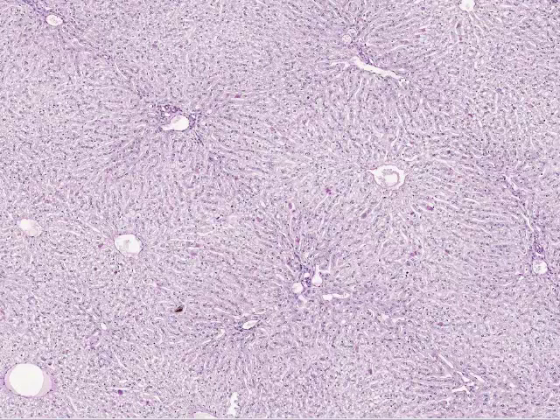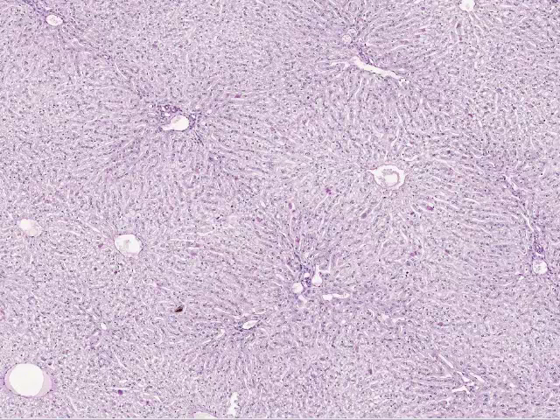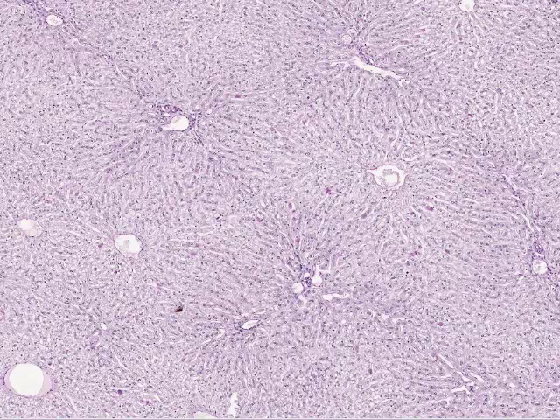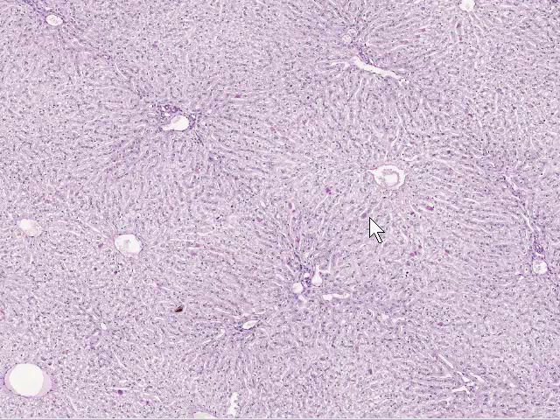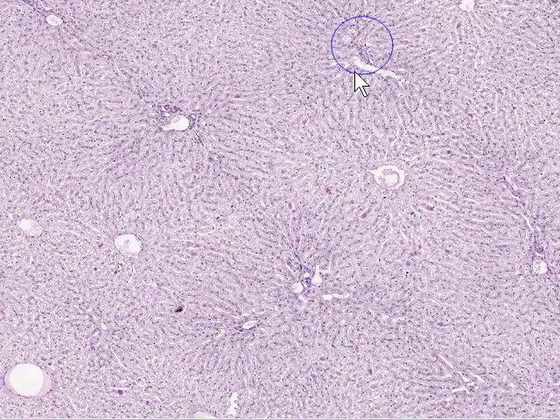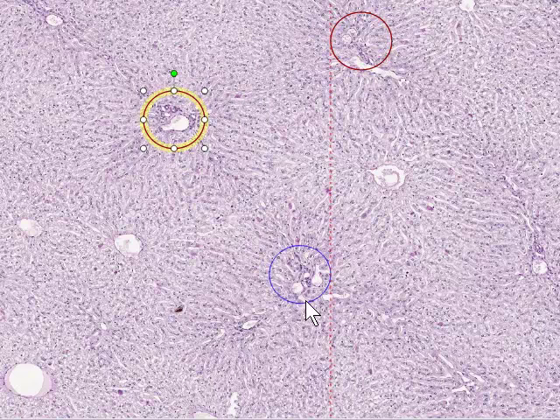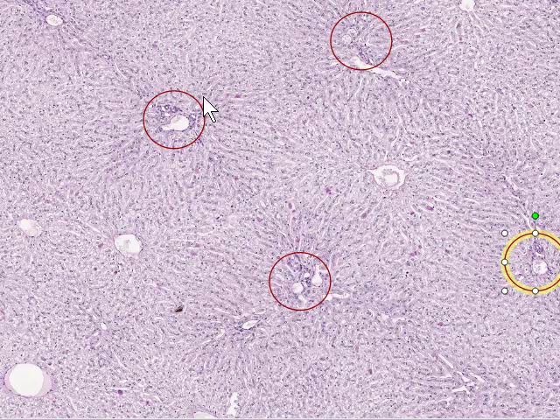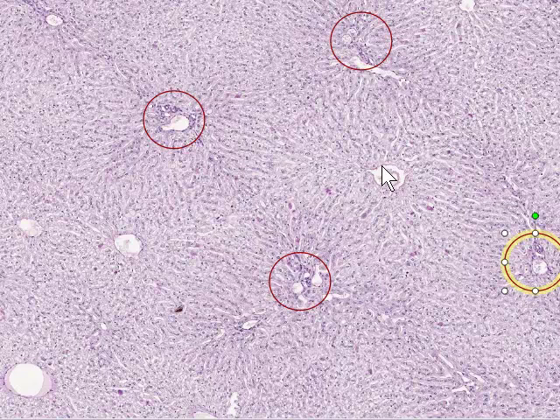Here's a still photograph from the same section of liver, showing how the notion of a hexagonal or geometric arrangement of structures centered around a central venule can be elucidated. Here we have a central venule with radiating plates of hepatocytes extending outward, separated by the little spaces which are the sinusoids. If we count up the portal canals surrounding this particular central venule — there's a portal canal here, and here, and here, and here — we can see there is some sort of geometric arrangement. In this case, it's a diamond shape organized around this central venule.